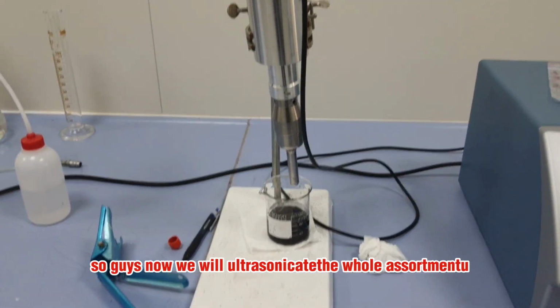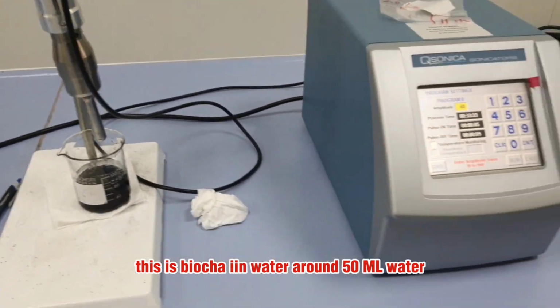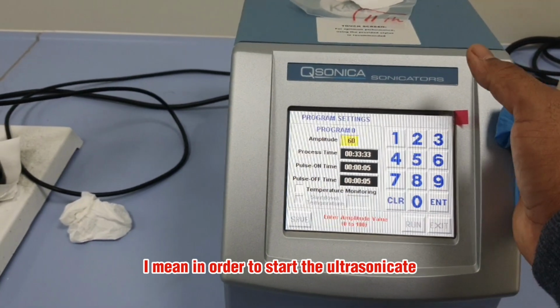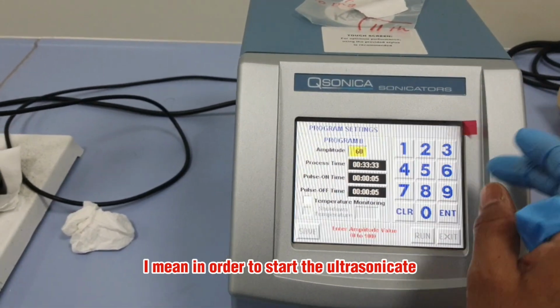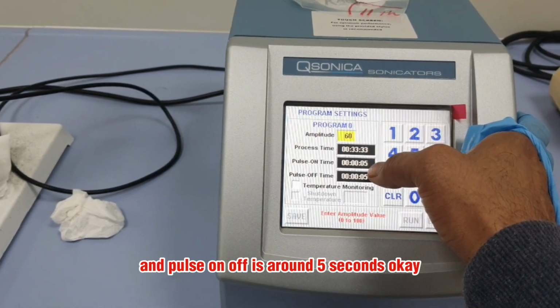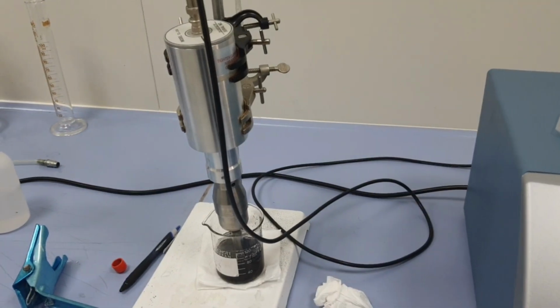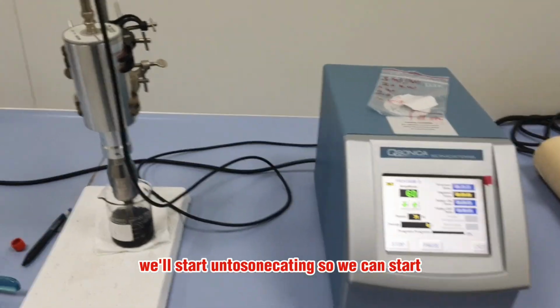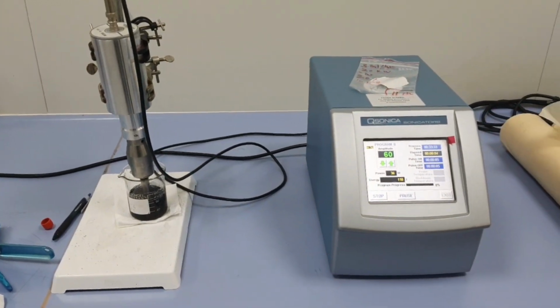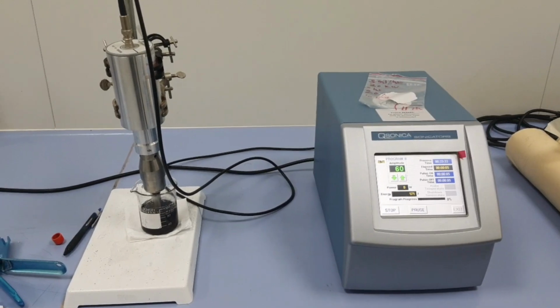So guys, now we will ultrasonicate the whole assortment. This is biochar in around 50 ml water. These are the experimental parameters to start the ultrasonication. This is 60 amplitude, around half an hour, and pulse on off is around 5 seconds. Okay, we'll start ultrasonicating. So it has started. We'll wait for around half an hour so that the whole assortment is well dispersed or well mixed.